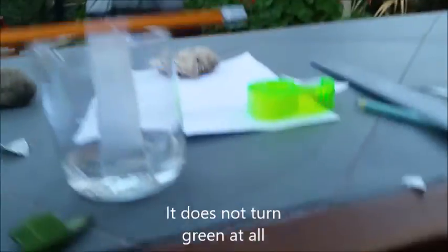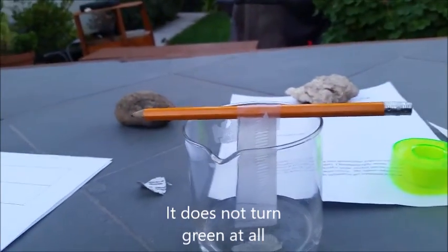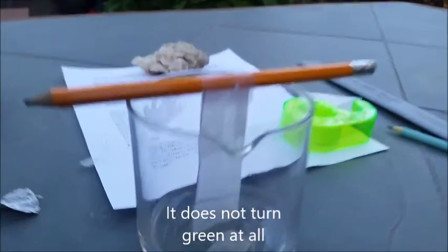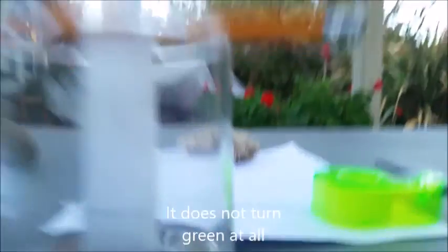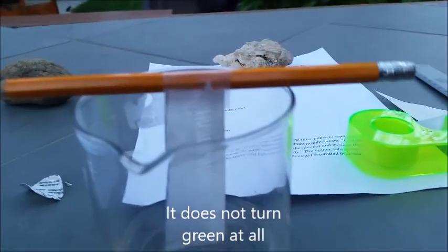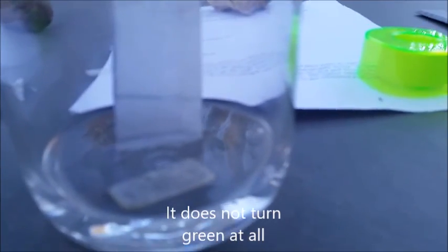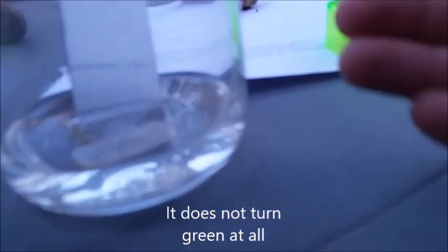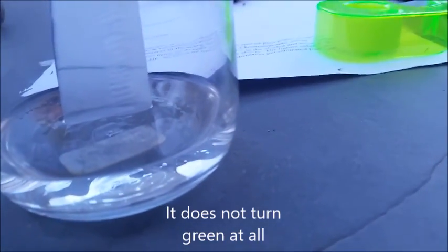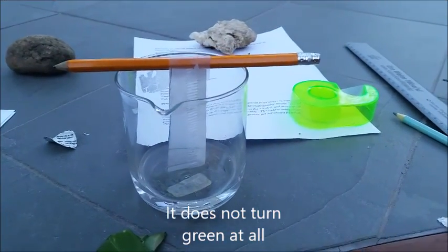So that's the experiment. I think it's supposed to be turning green, but either we didn't use enough alcohol or something. It is wet all the way up, as you can see — that line right there is where it's wet. I think it's supposed to carry the leaf pigment up. Yeah, right, this is for the students. Okay, that's it. Hope you enjoyed. Goodbye.